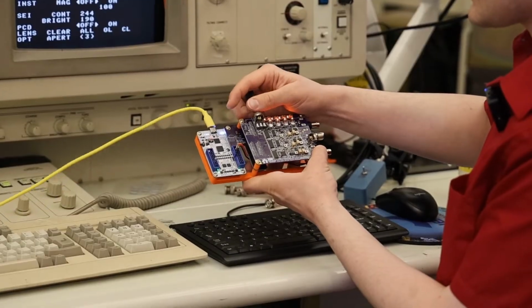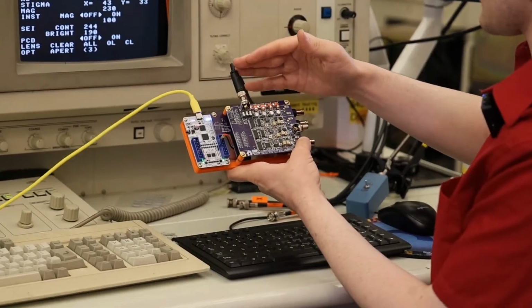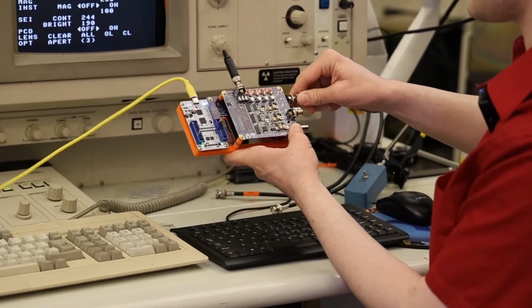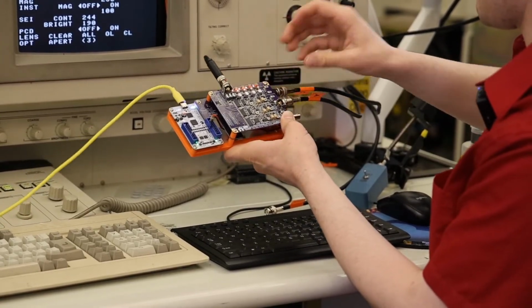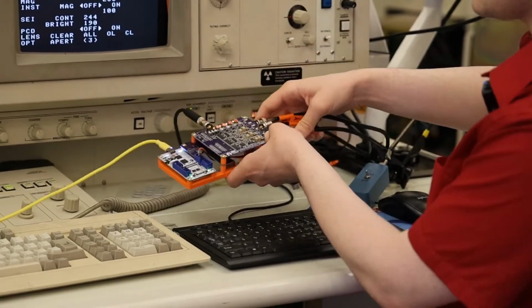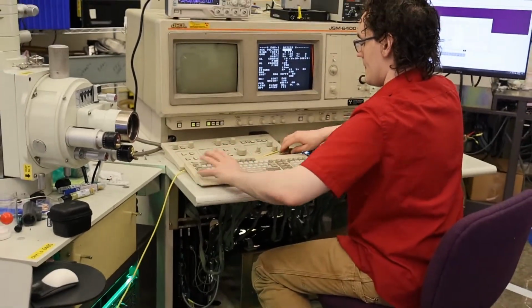There is a sequencing on the power supplies, so they only turn on in the correct order. So we got power plugged in, and now we're going to plug our X into our X BNC there, and we're going to plug Y into that one. And our detector, we're going to plug into that one. So we're done messing around behind the microscope. We can go ahead and bring up our high voltage now.